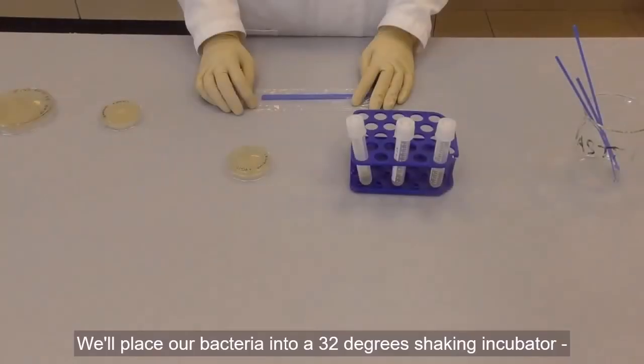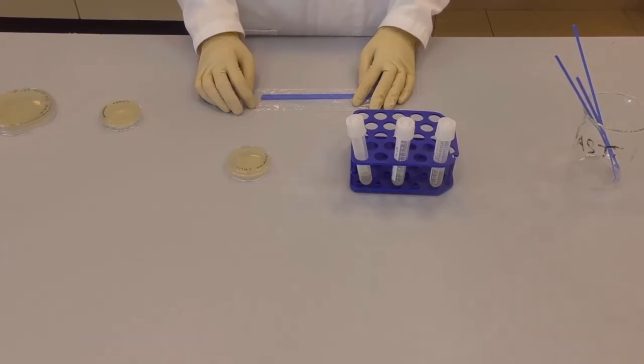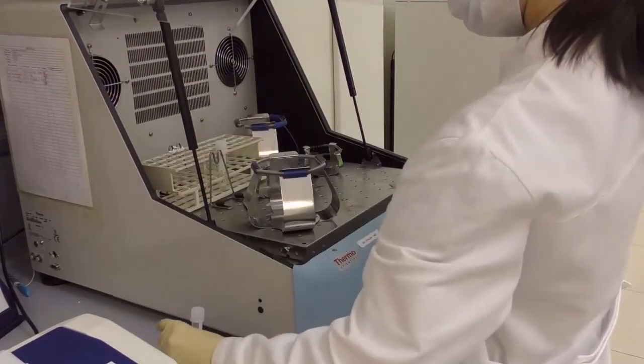Now it is ready to be placed in the 32 degrees shaken incubator. You are going to incubate it overnight. We set the temperature of incubation to 32 degrees to make sure that our bacteria do not overgrow in the tubes with medium.